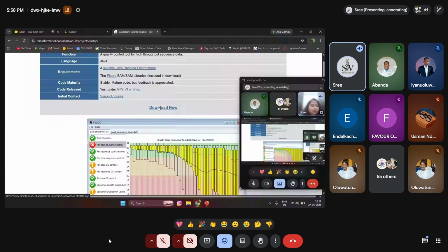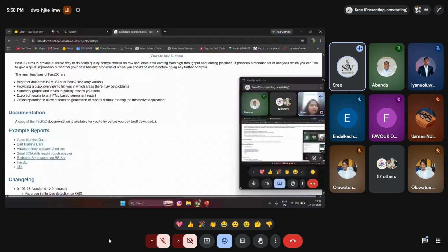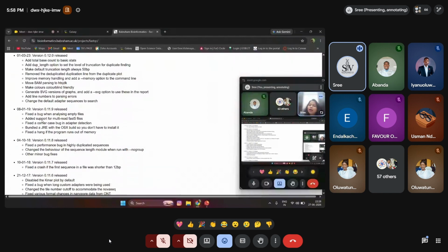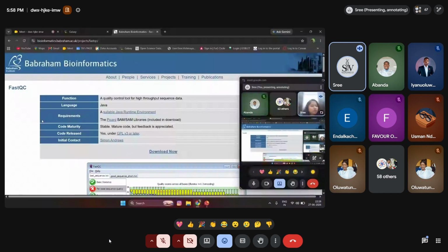We can come down and see the documentation, how we can get into the data, and examples of the different formats, all those things. That information has been highlighted over here.